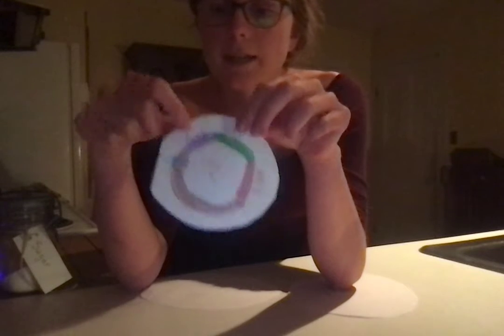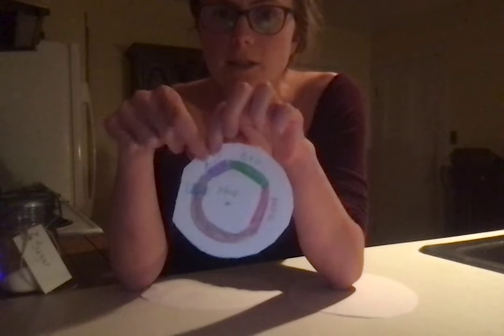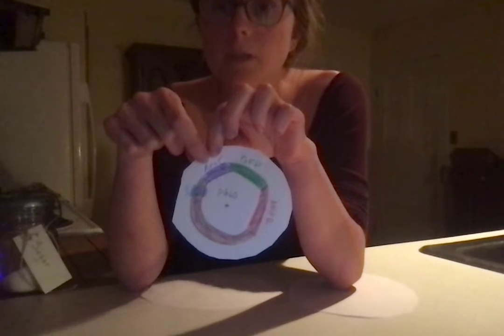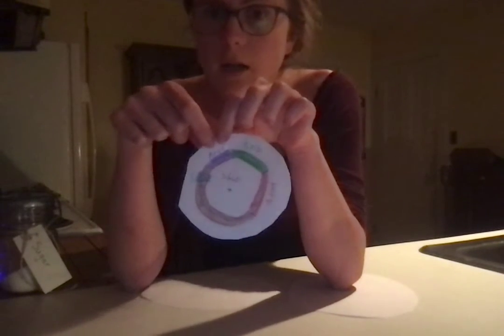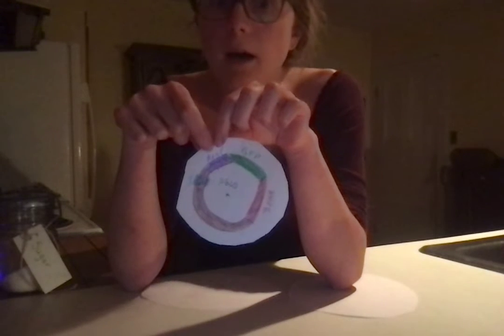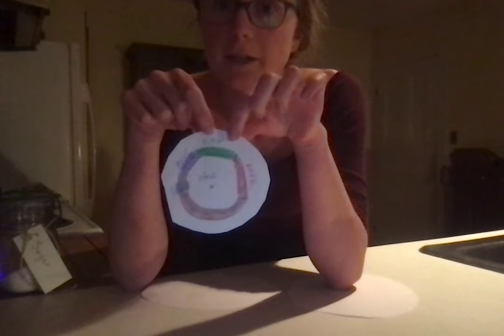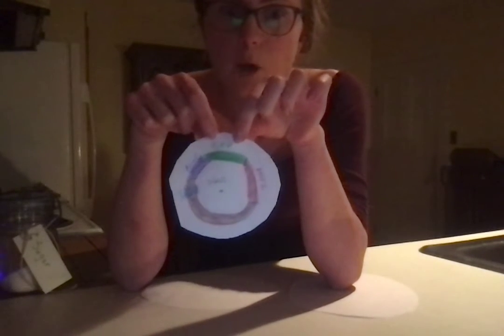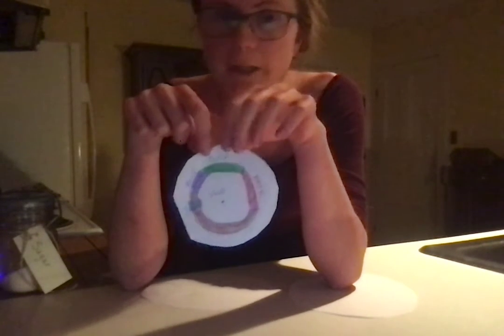We have the ARAC gene. This is the site that regulates the transcription of GFP, of the GFP gene in the experiment. So this is our active site for our sugar arabinose. Once we add the sugar, it will turn on the GFP gene, which is right here. The GFP gene codes for green fluorescent protein, which we hope to activate at the end of the experiment, turning our culture green, bright green, glowing green.